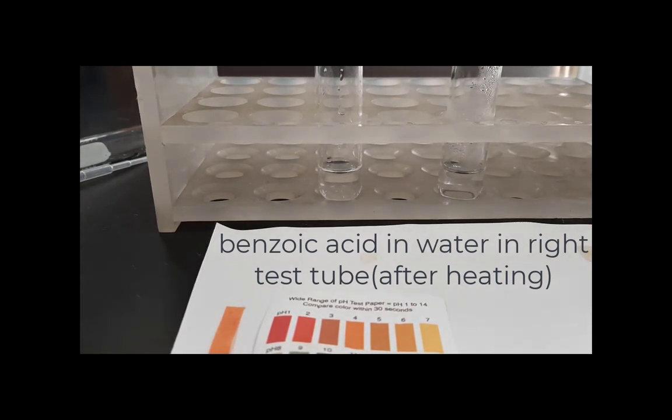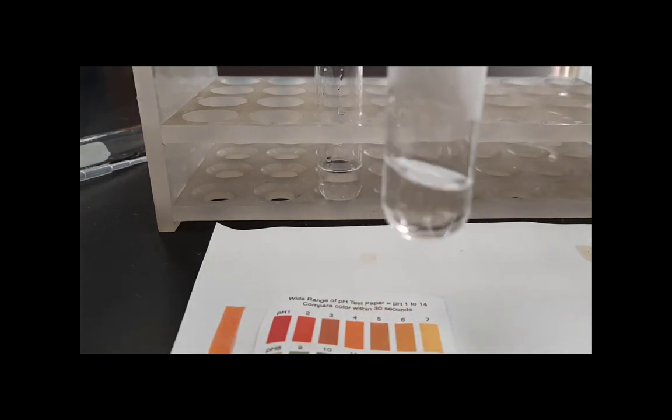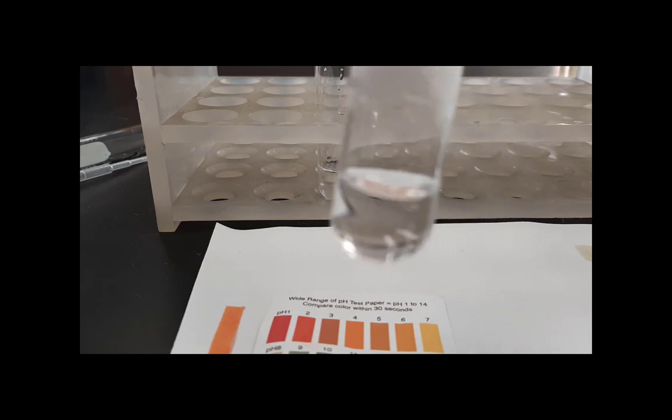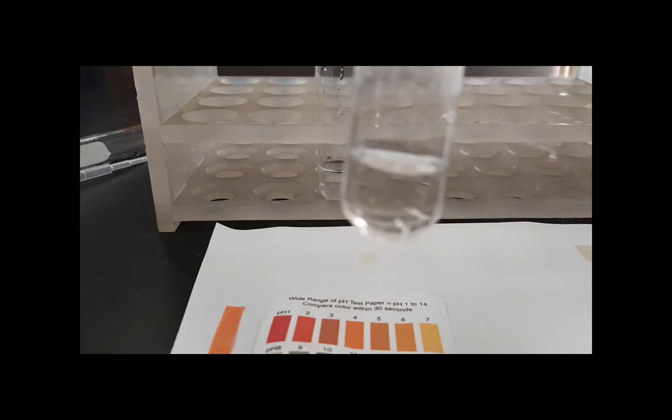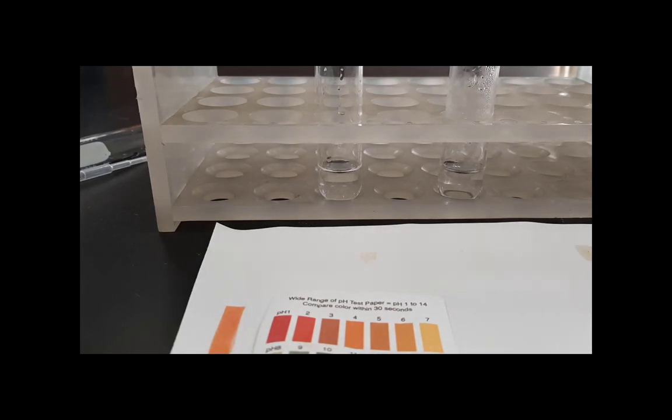Now we're only going to look at the test tube on the right. It's the benzoic acid in the water. After heating, you'll notice that you don't see any crystals. With many compounds, we notice that they are more soluble in hot solution rather than cold.